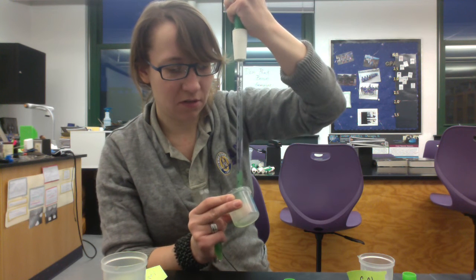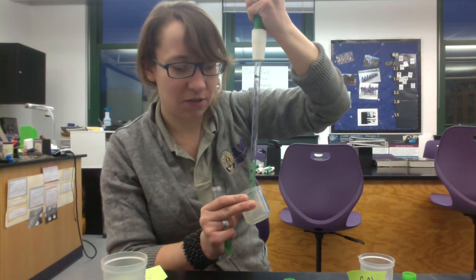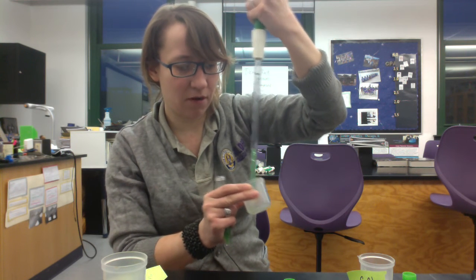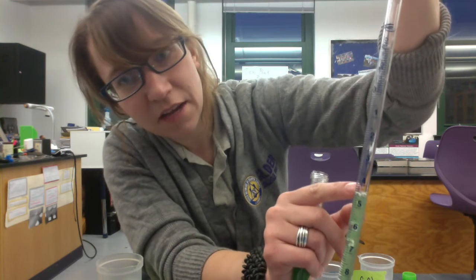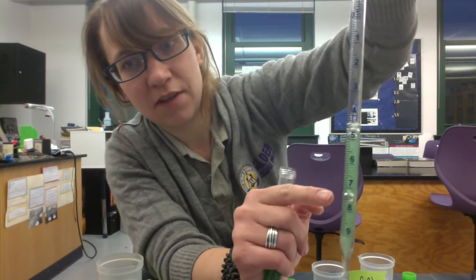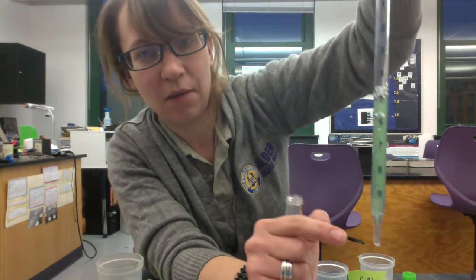I've got my solution drawn up into my pipette. It was three and three, so we should now have a total of six milliliters, which means the pipetter should be at the four mark — and it's almost there. It didn't make it all the way because I didn't want to draw up all the solution and get a lot of bubbles. I do have some bubbles, so I'll give this a minute to rise to the top so there's no bubble at the tip where I'll be doing my work.